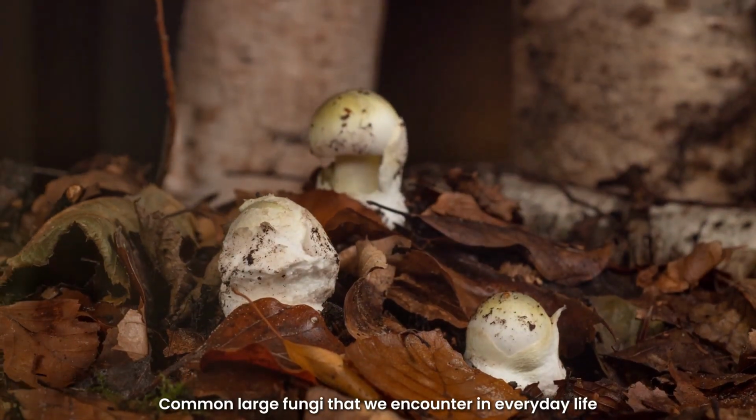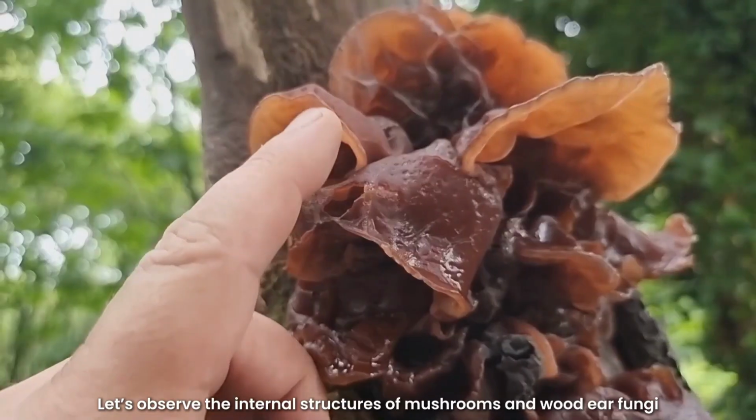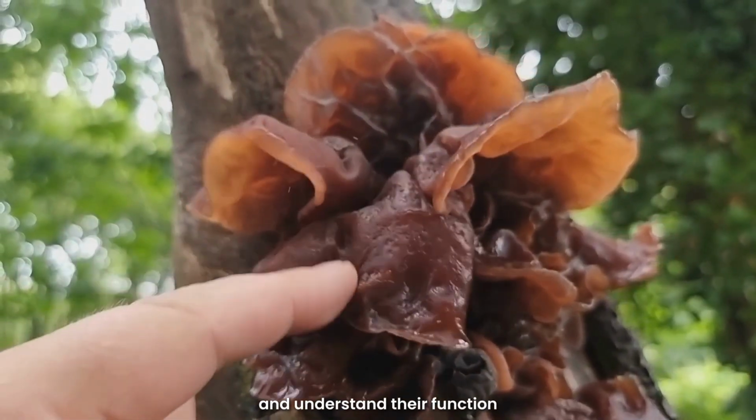Common large fungi that we encounter in everyday life include mushrooms and wood ear fungi. Let's observe the internal structures of mushrooms and wood ear fungi and understand their function.